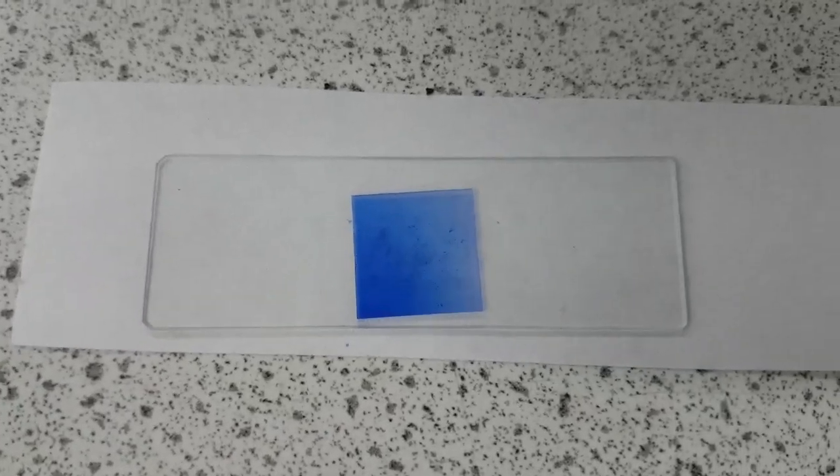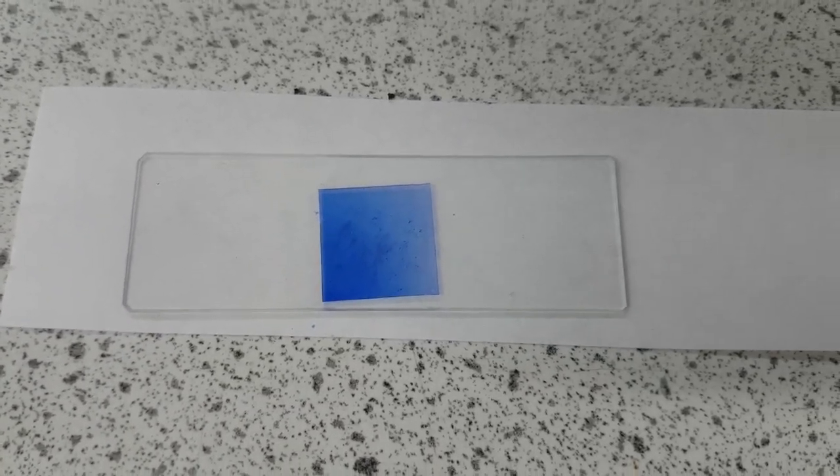So as you can see it's become much lighter and now we can use the microscope. I'm going to show you how to use the microscope next.